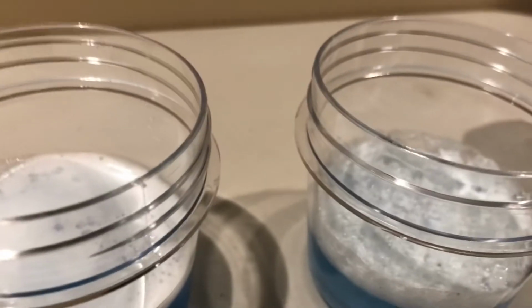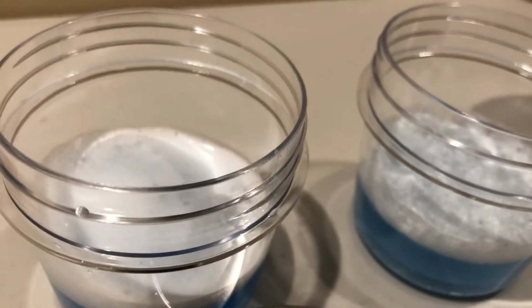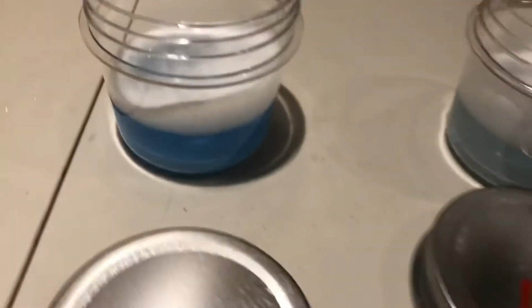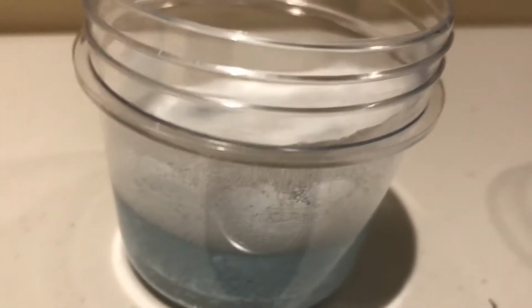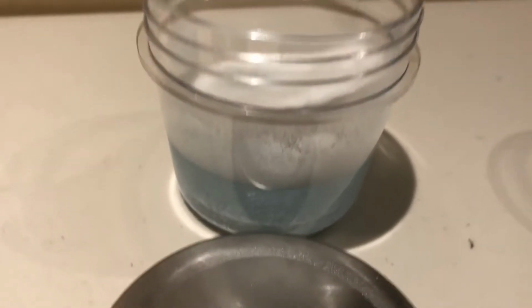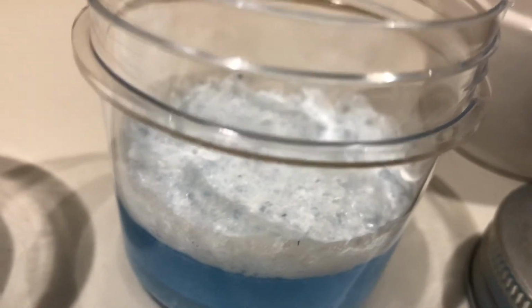And how do you increase the chance of effective collisions? By increasing the what? The frequency of collisions. So once again, guys, hopefully these three make sense. I want to do one more, a catalyst, in a second. So this was temperature over here, the higher temperature one. This one was concentration. We agreed that the higher concentration one won, though maybe I should have made a bigger difference in the dilution, but it still showed the effect. And with this one right here, we saw that the higher surface area one initially won. Okay, alrighty. All right, guys, back.